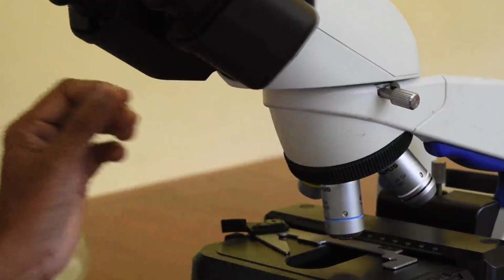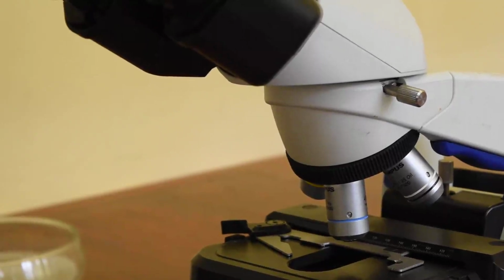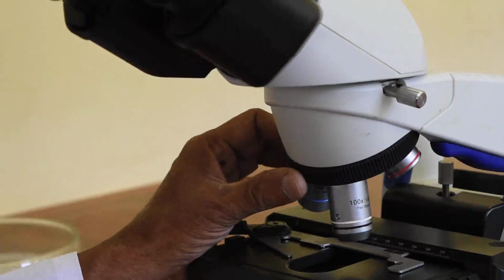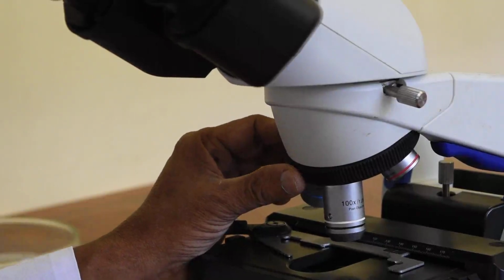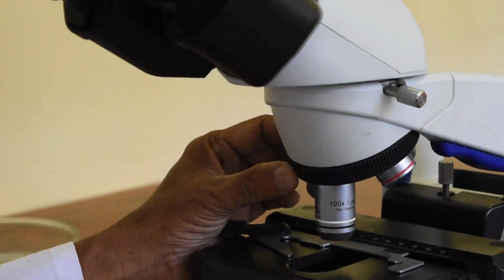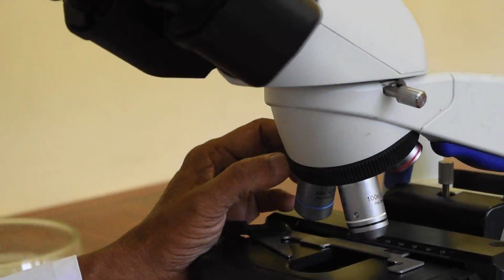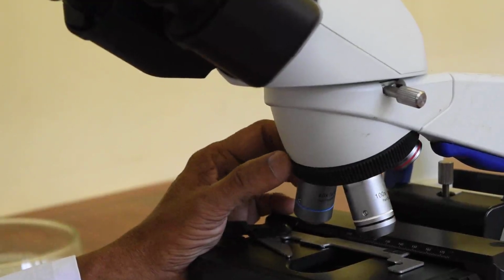And it is the same with oil immersion. So oil immersion is the next objective that we are going to look at. Oil immersion is the objective that has black color line and a white color line. So that one also has a very minimal distance between the stage and the objective. So you have to use only the fine focusing when you are focusing with the slide. So you have to be very careful. If you move the focusing very roughly and hardly up and down, it might break the slide. Okay, so those are the objectives.